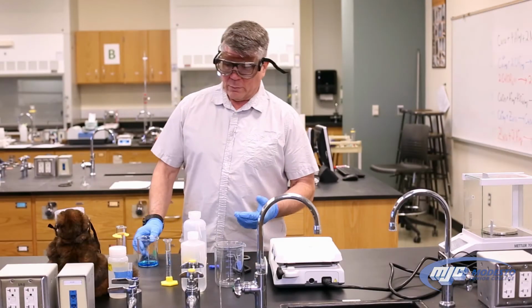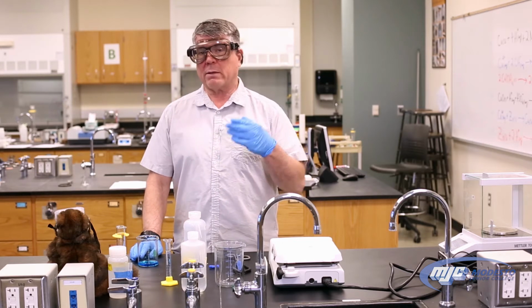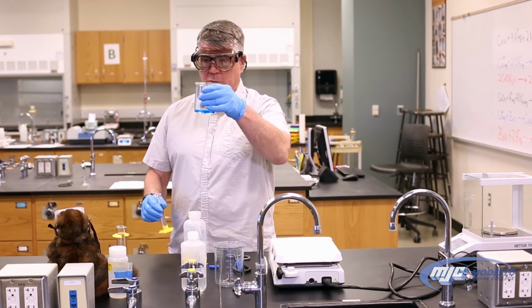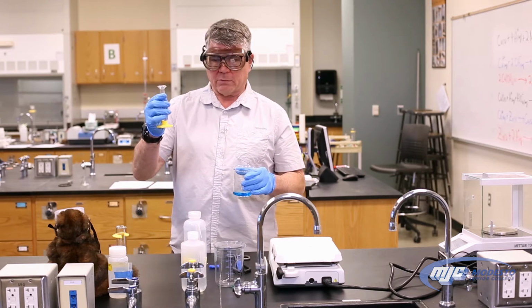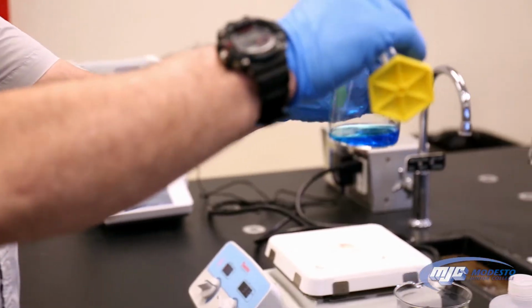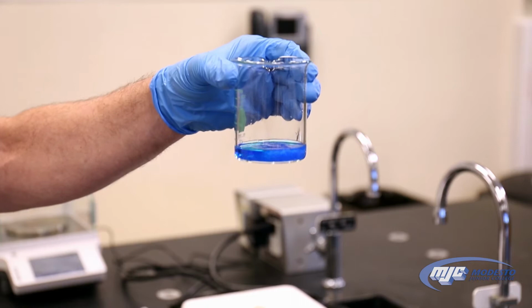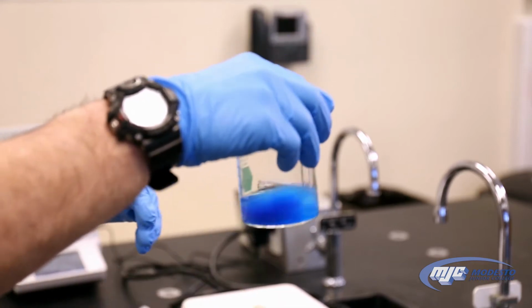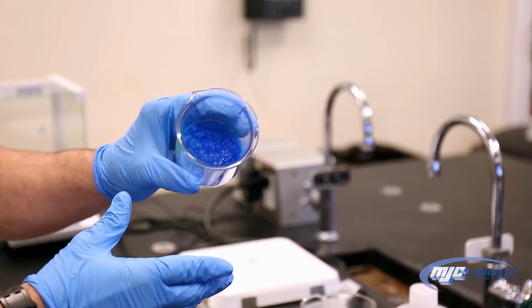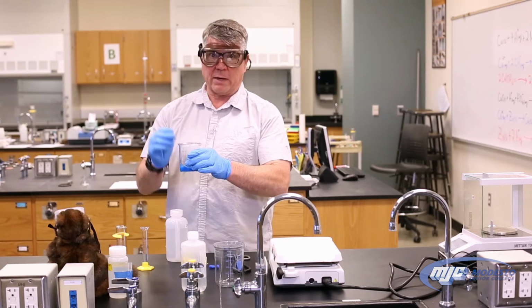All right, guys, so now we're ready for the next step, which is exactly, by the way, the same reaction we did back in the gravimetric analysis lab. We're going to take the copper 2 ion that's in solution, and we're going to add about 10 milliliters of 6 molar sodium hydroxide to it, just like this. And there we go. It's that bright blue flocculent precipitate. I guess it's flocculent. That's copper 2 hydroxide.